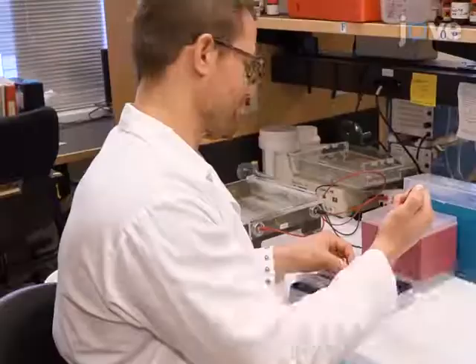I will be demonstrating the plate reader-based mitochondrial calcium uptake procedure, and Dr. Joshua Maxwell, an instructor in the Department of Pediatrics, will be demonstrating the confocal microscope-based procedure to measure mitochondrial calcium influx.